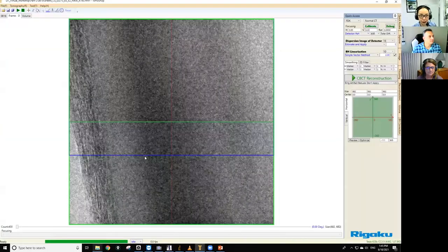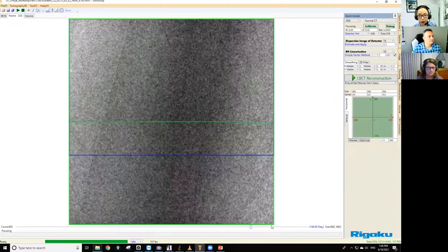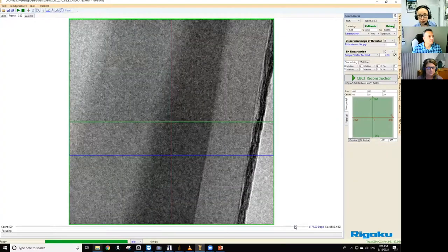So we'll look at this one. Again, we did a 3x3 binning and it got 400 projections. When you look at the sample from the side, you see the center part is darker, that's UV resin, and you have parafilm on this side, you have paper, and you have another polymer sheet on this side. And you can clearly see that the UV resin is higher density.